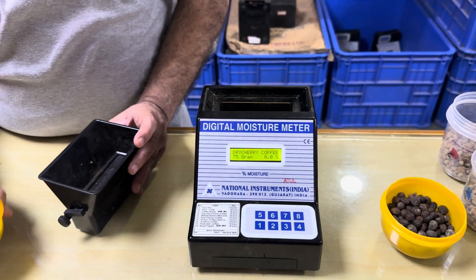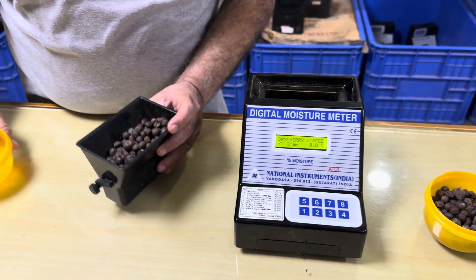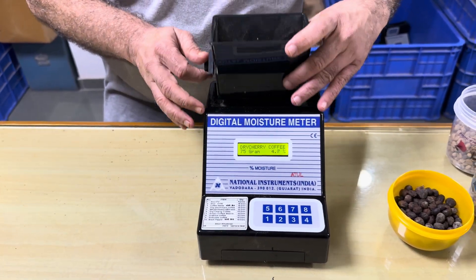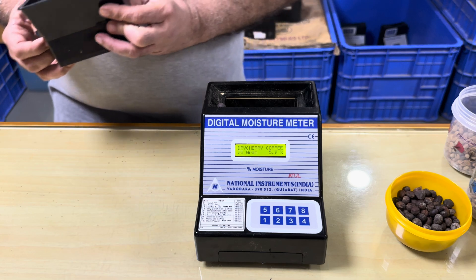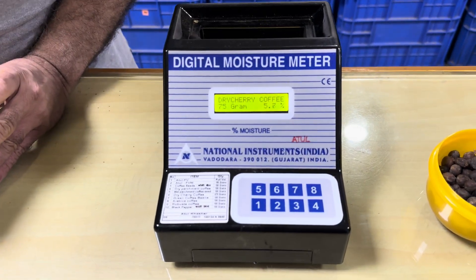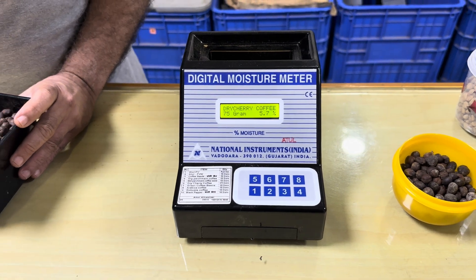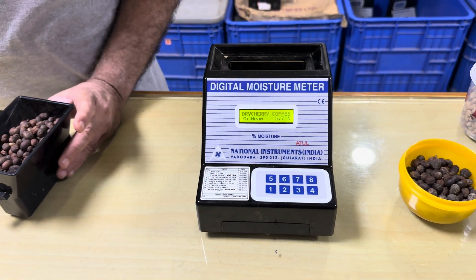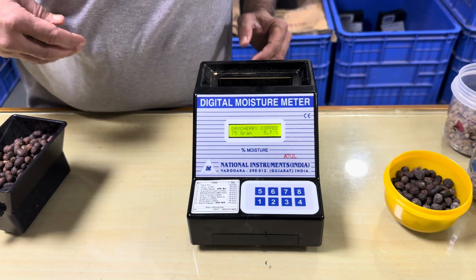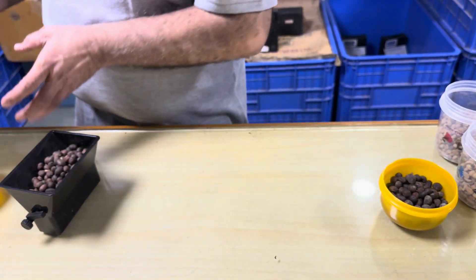Now I am taking another sample. Once again it shows 5.6% to 5.7% moisture in dry cherry.